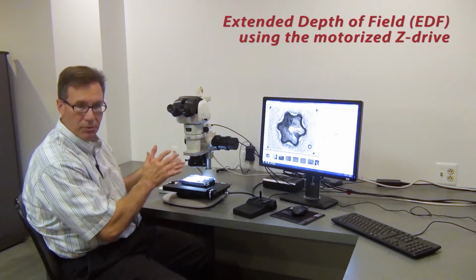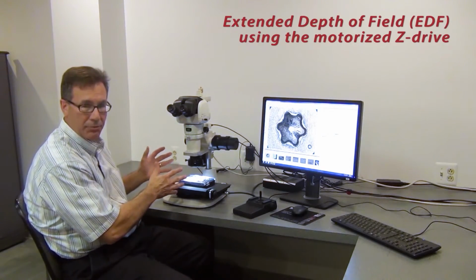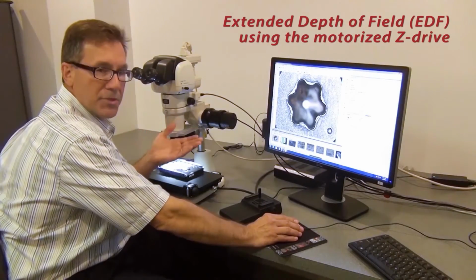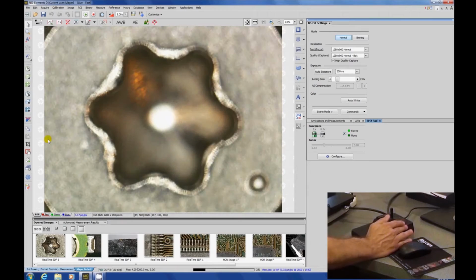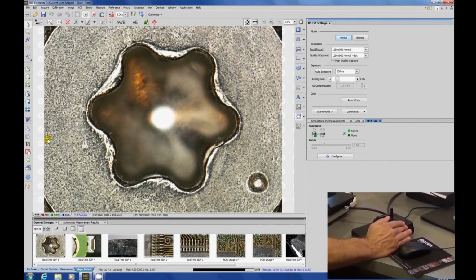This allows us to go in and automatically create all-in-focus images when we're looking at samples where we can't get everything in focus in one plane. So first I'm going to show you a very simple technique. Here we see we have an image where as I focus up and down, different parts of the image are in focus and I can't get them all in focus at once.